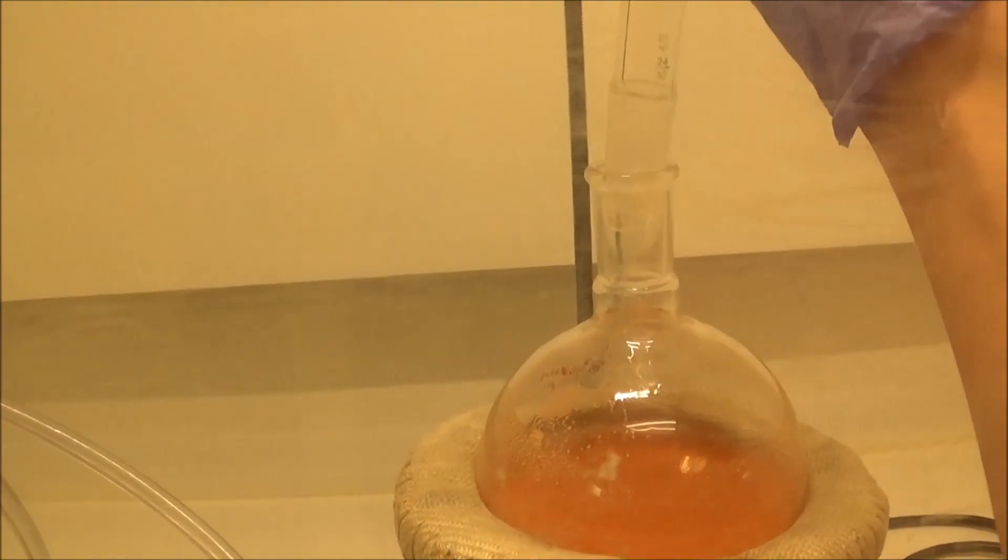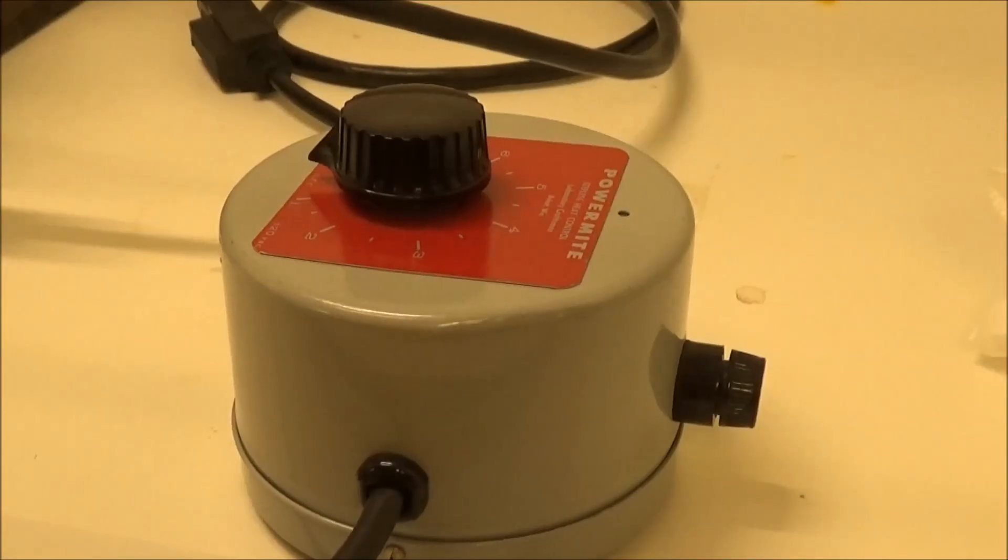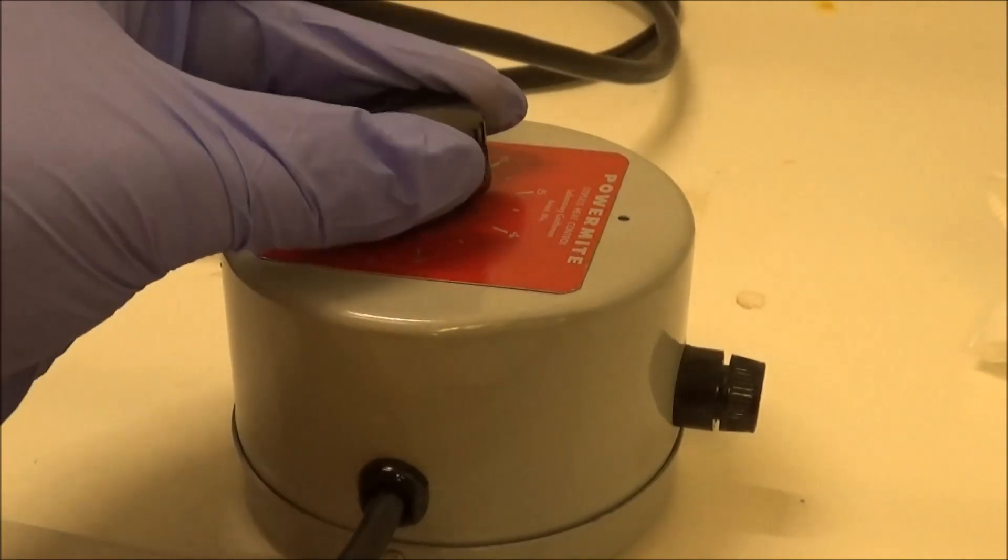Then I set up for reflux, and let it go for 4.5 hours. Org Syn recommended 5 to 6 hours, but this was late the night before Thanksgiving, so I cut it short.